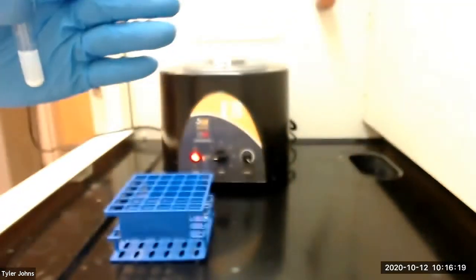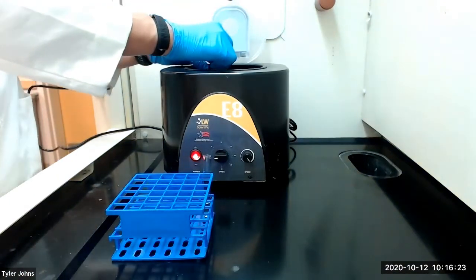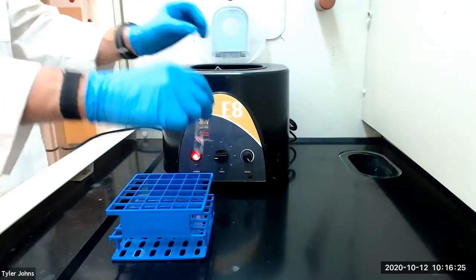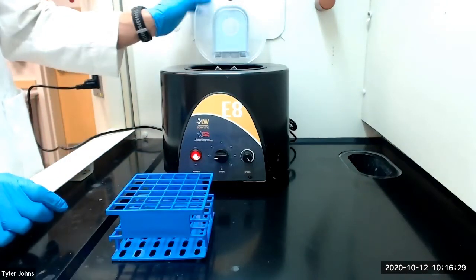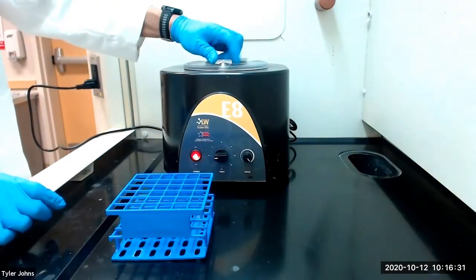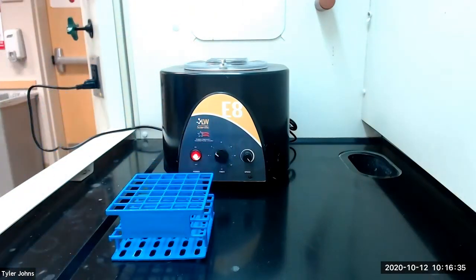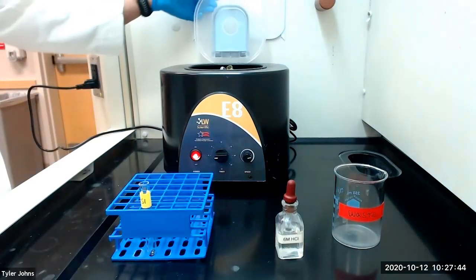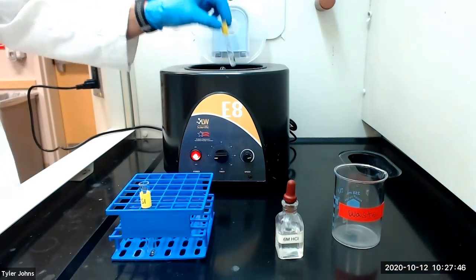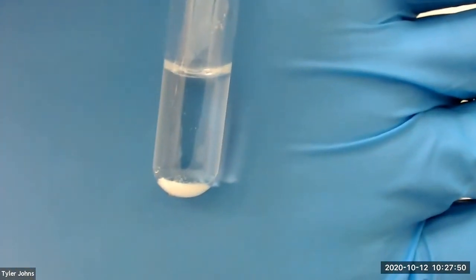We then need to centrifuge our test tube with our test solution. When you're centrifuging, always make sure that you have a balance in the centrifuge. After centrifugation has completed, we need to remove our test tube, and you can see that all of our precipitate has been centrifuged to the bottom of our test tube.